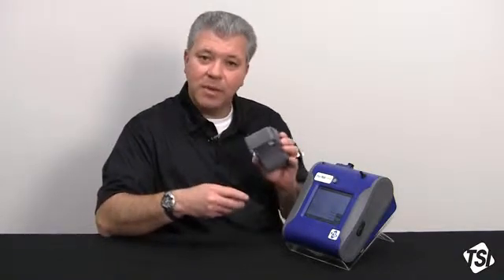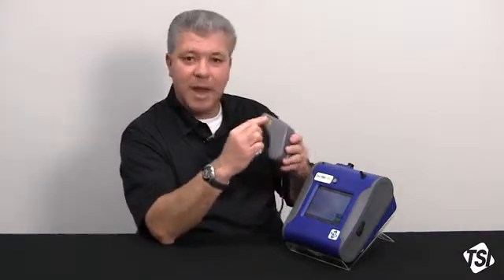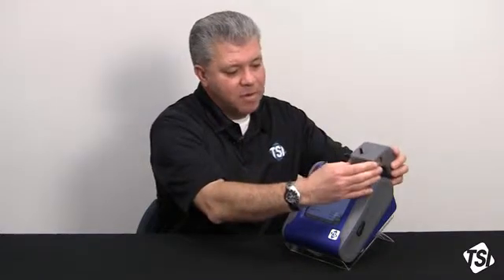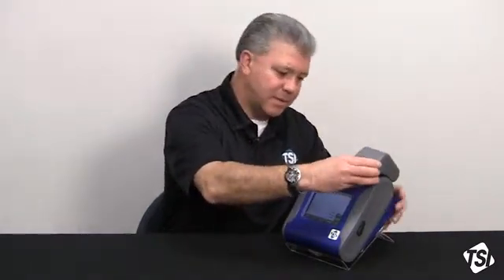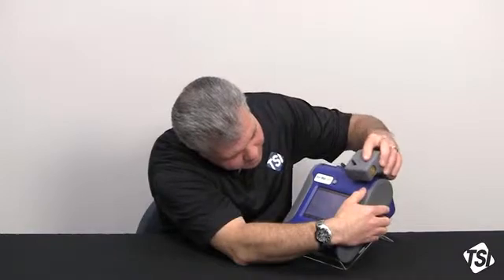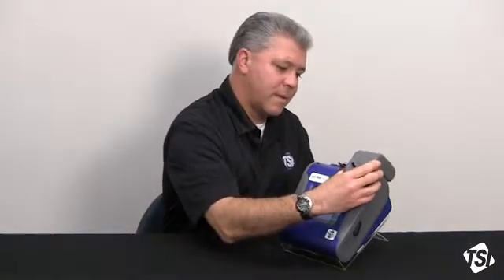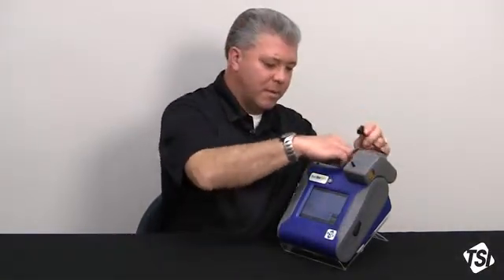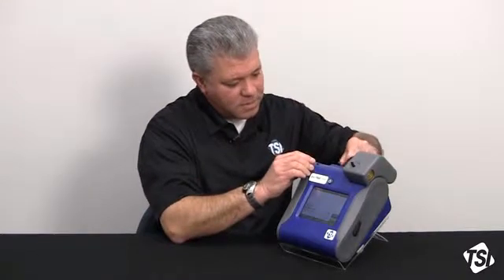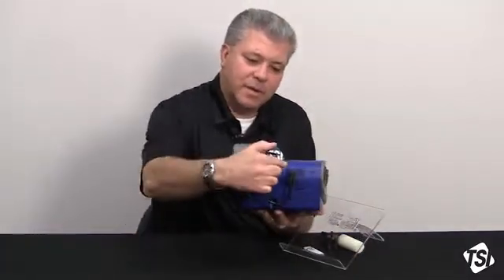So let's get started with attaching this to the DustTrak. The AutoZero module consists of a small pump. There is a HEPA filter inside here that provides HEPA filtered air. I'm going to attach the AutoZero module to the top of the DustTrak, or the inlet, and you simply slide that on. And then the small electrical cable gets its power to run the pump from the DustTrak. There's a small locking connector, and that plugs into the back of the instrument right like this. There's your connector right here.